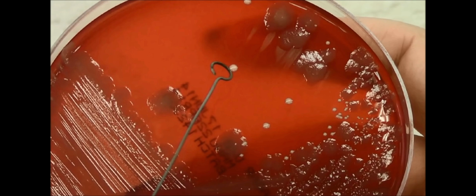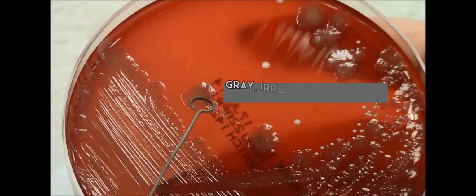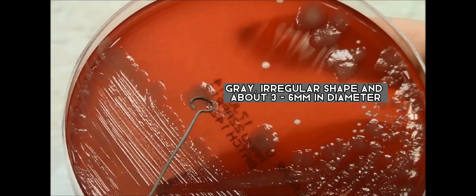Here are some examples of colonies that can be found in the blood agar plate, in which the first colony that we can identify has 2 millimeters in diameter. The second colony, as you can see, ranges around 3 to 6 millimeters in diameter.